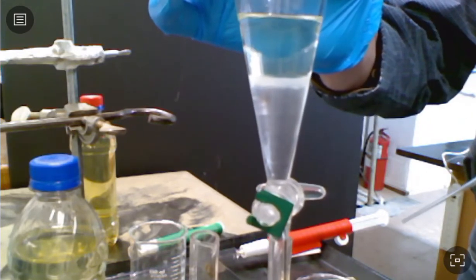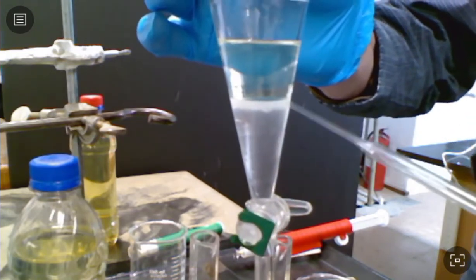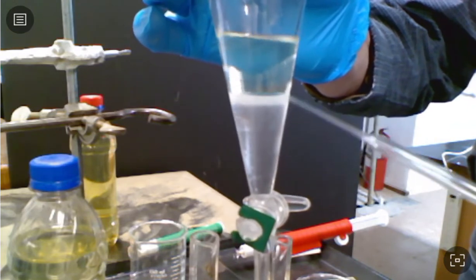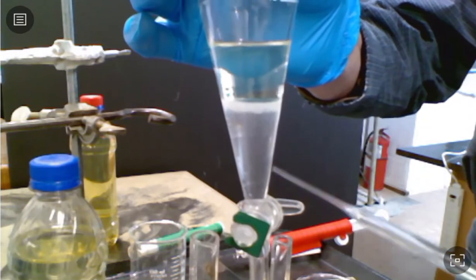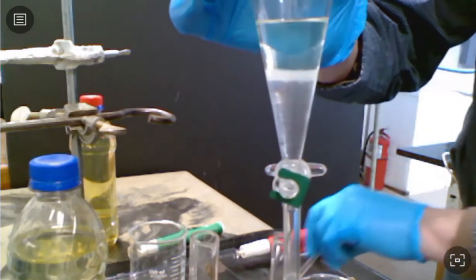It's not gasoline. You can see right here in the middle, we're getting this emulsification kind of a layer. Unfortunately, once we do our extraction, the whole water layer will look kind of cloudy like that. But we'll see if we can get that to clear up. So now for our extraction.